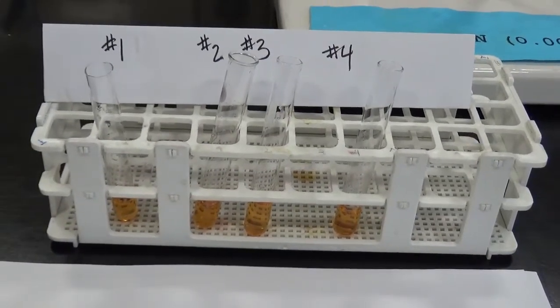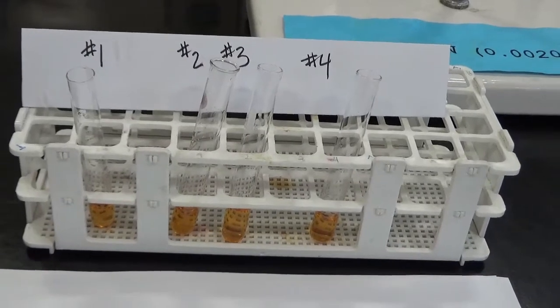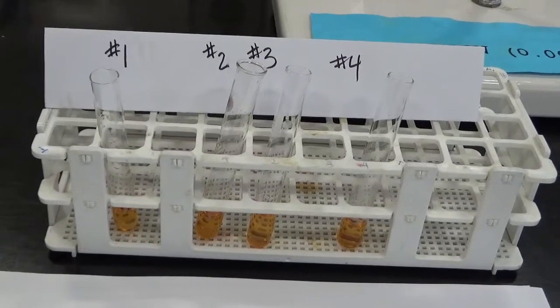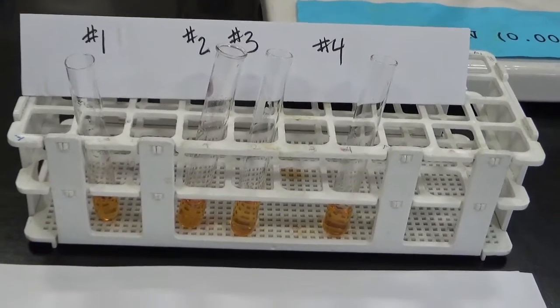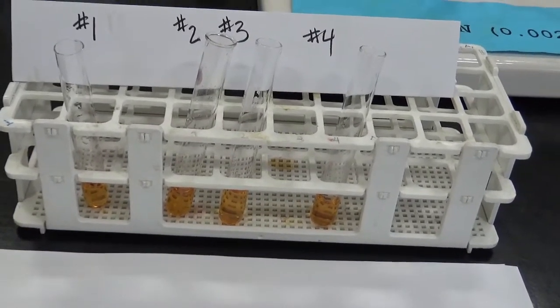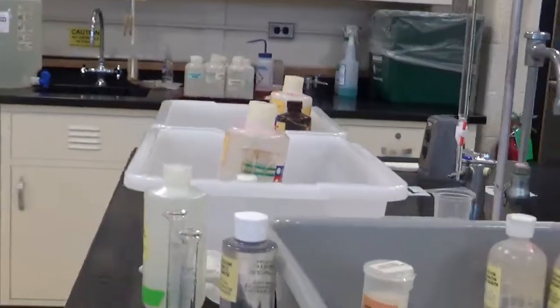This is going to allow us to figure out which of those ions are involved, because there are 4 ions in solution, 2 positive ions and 2 negative ions. And we're also going to figure out whether this reaction goes to completion or exists at a state of equilibrium.